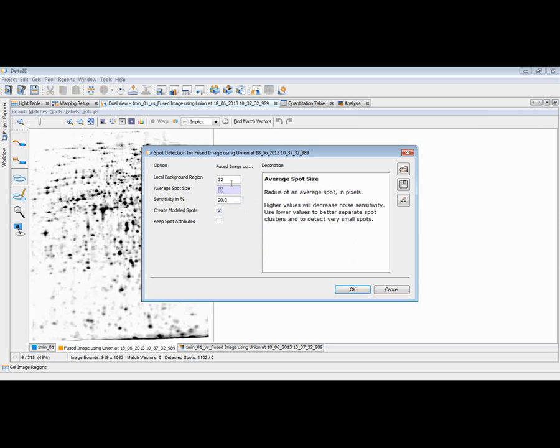By the way, you can create as many fused images as you like with different settings, maybe change the warping, improve the warping, do a fusion again. It doesn't matter, but then of course you have to be aware on which image you want to detect the spots, which fused image you want to use as the basis for the spot transfer later on. So don't get lost in all the different fused images. And on a certain fused image, as we have it here, we can repeat the spot detection as often as we like.